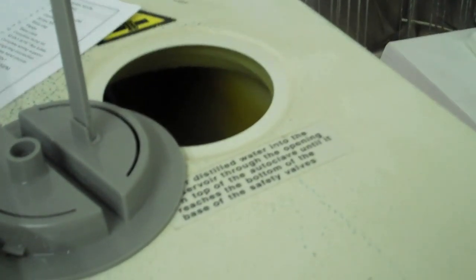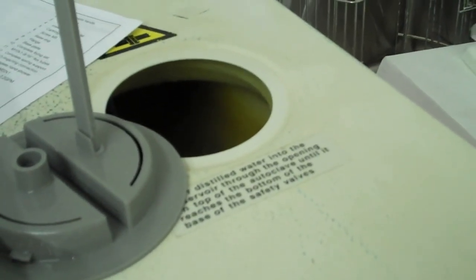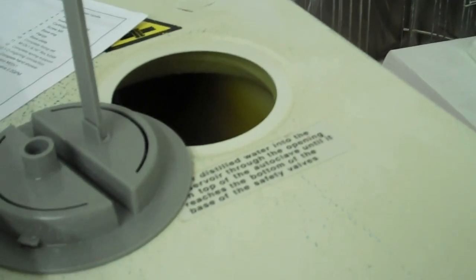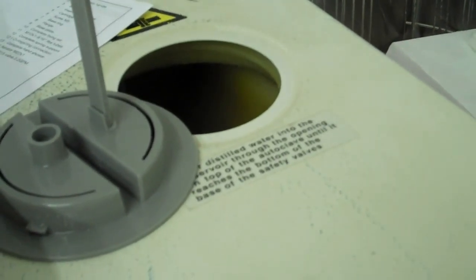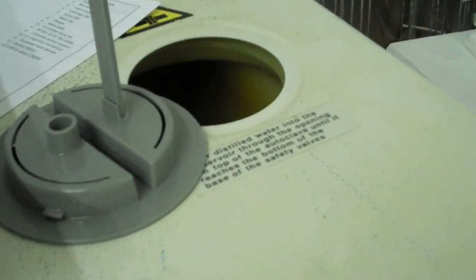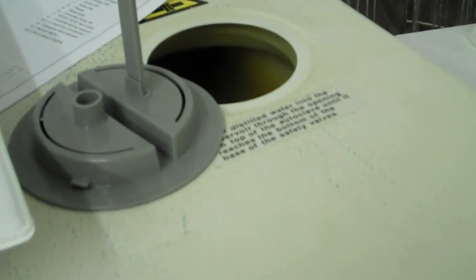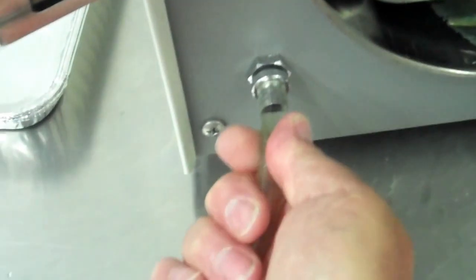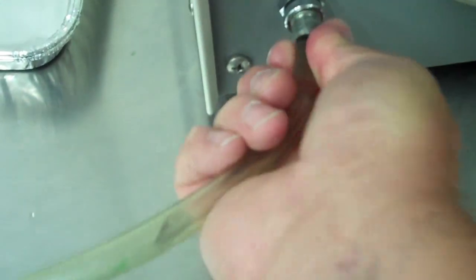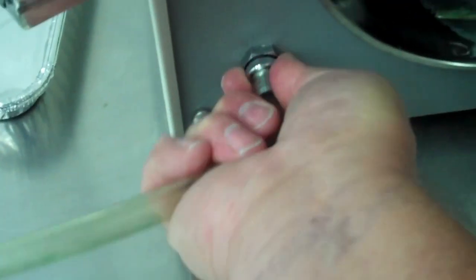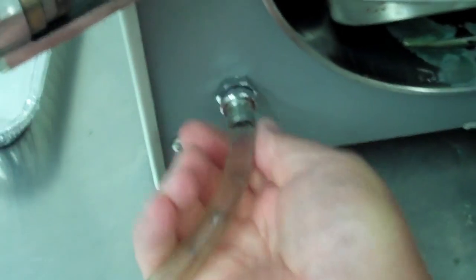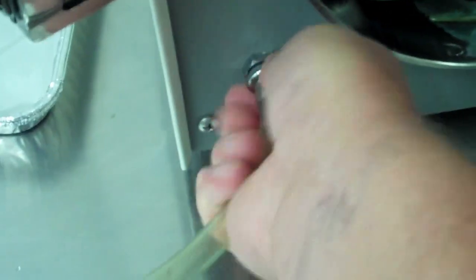You can do this to flush the tank. You drain and then you replace the distilled water in the tank and that will purge out any debris that could be pulled into the tank. That's a procedure you'll do as needed if the water in the tank starts looking brown or turbid or not clear like distilled water should be.